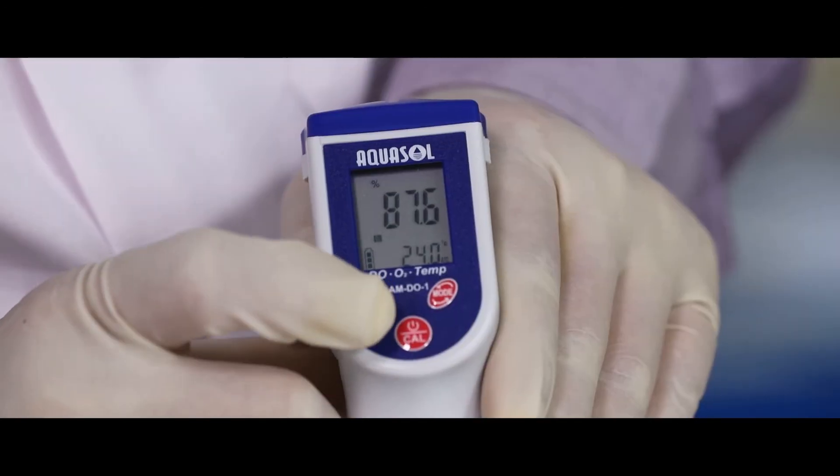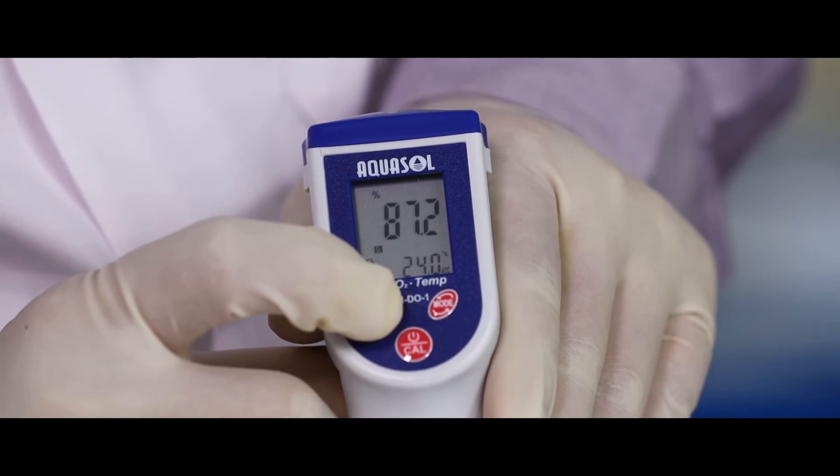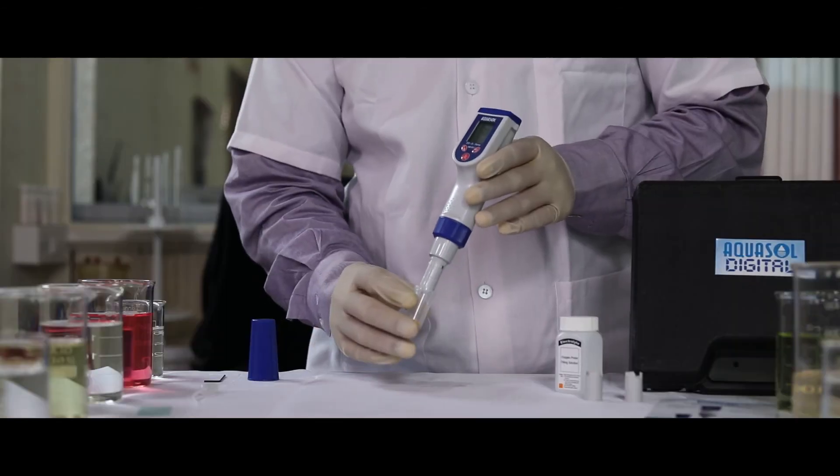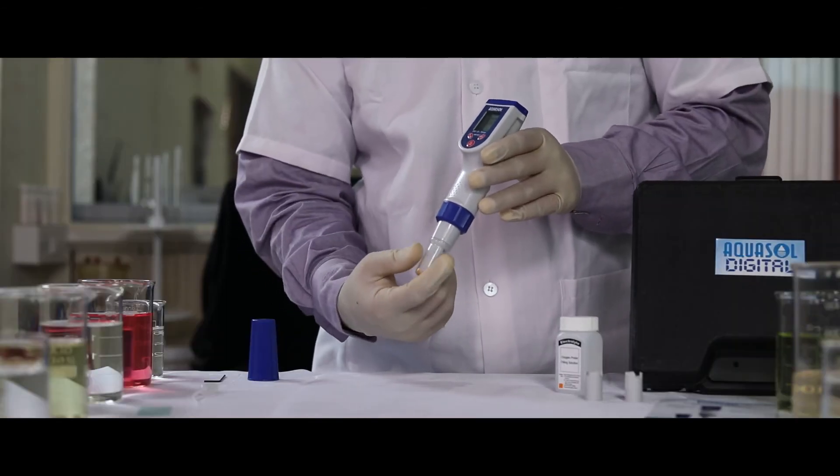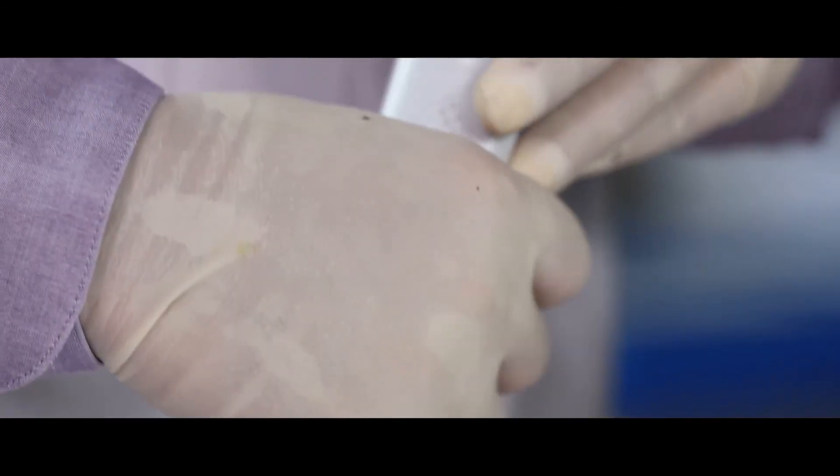Press H/M key to hold the reading. Recap the soaking bottle cap to secure the electrode. Make sure it is wet.